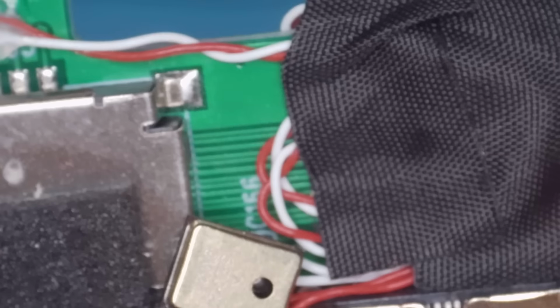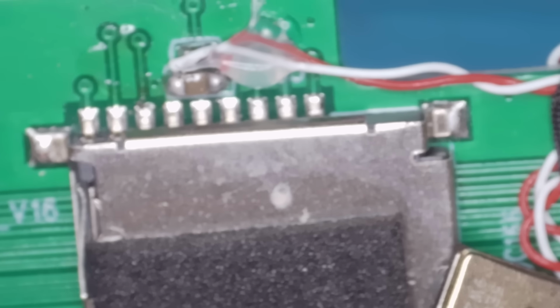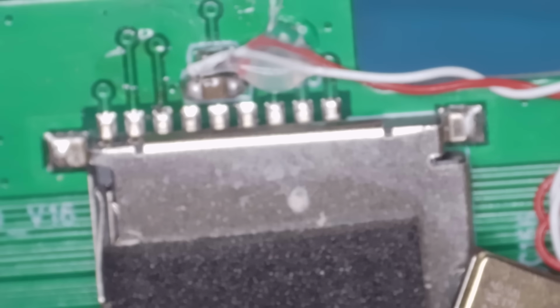This is how they've done it. And under here there's just a coil of wire basically, just where they've extended the wires here. And they've just coiled it up here and put a bit of tape on to hold it. I did have a look under there in case there were any additional components, but no. Right, let's pull the microscope apart then.